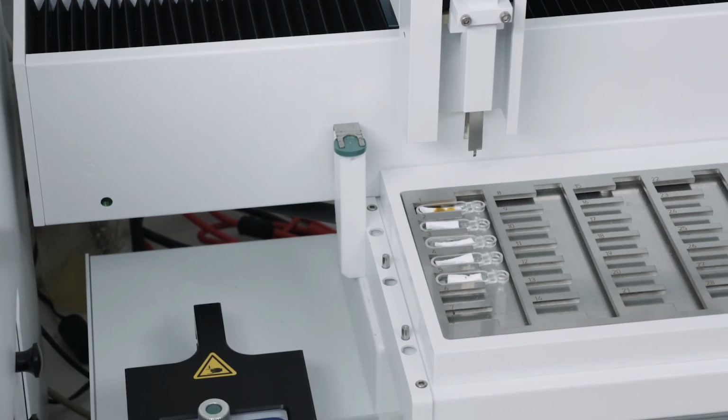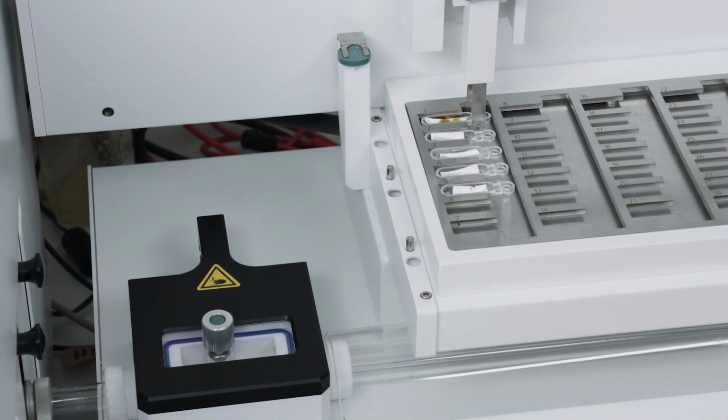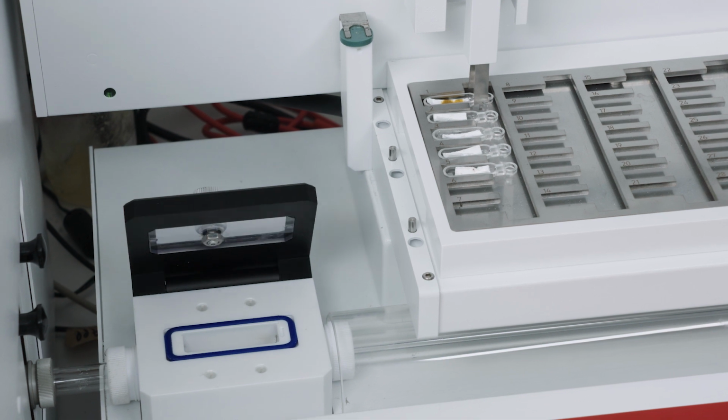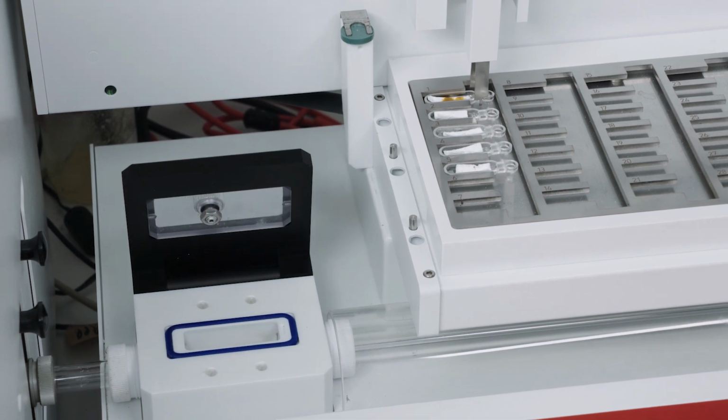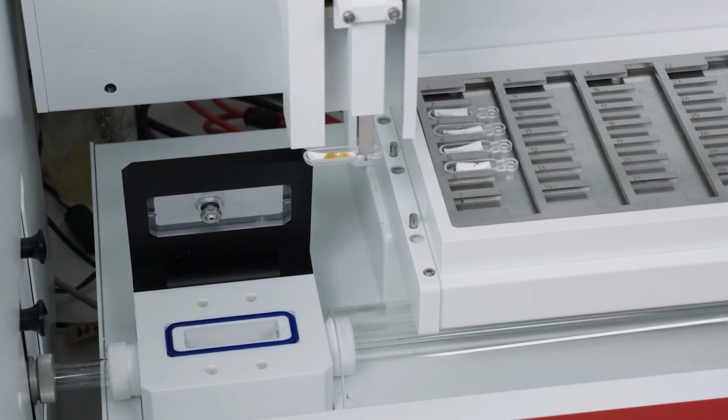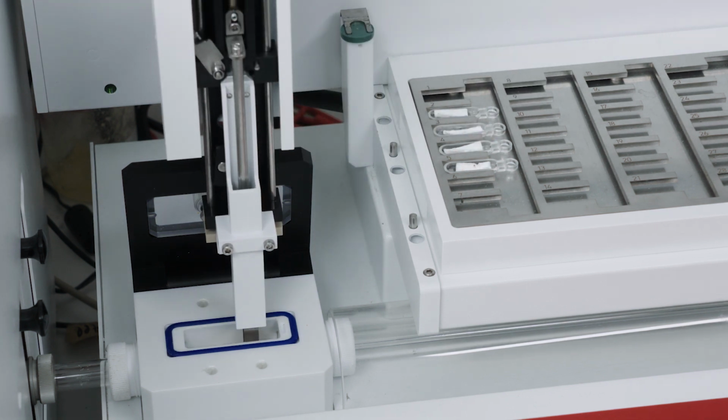The analyzer offers both vertical and horizontal operation. For the analysis of oils, only the horizontal mode can be used. Here the oil or dilution is injected into quartz sample boats, which are transferred by a boat inlet system into the combustion zone. It is important to adapt this process to the specific needs of each sample matrix and sample quantity. Before the analysis, also the hardware has to be prepared.